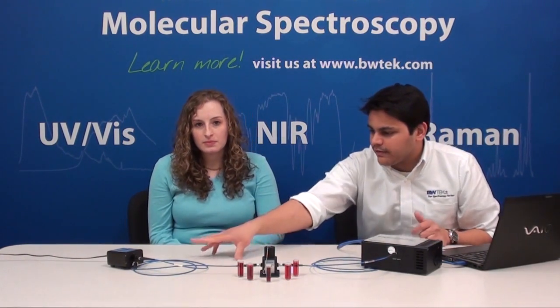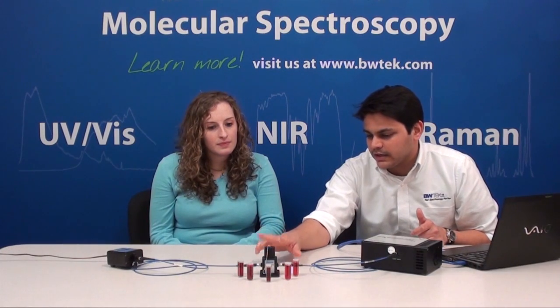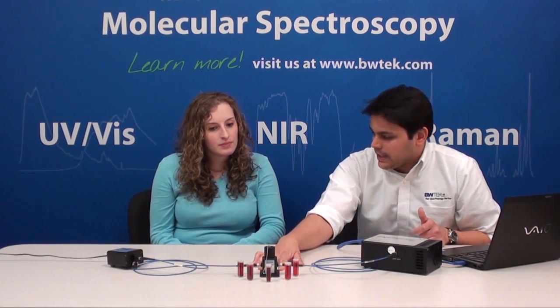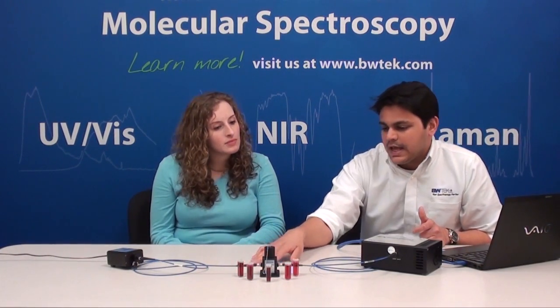All of that is attached to a two-port cuvette holder through fiber patch cords, and then again through fiber patch cords directly into the spectrometer.